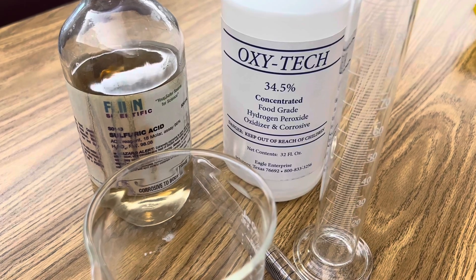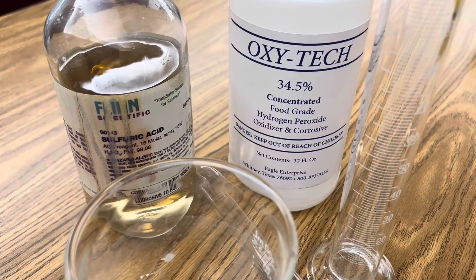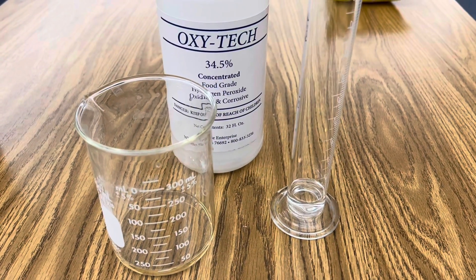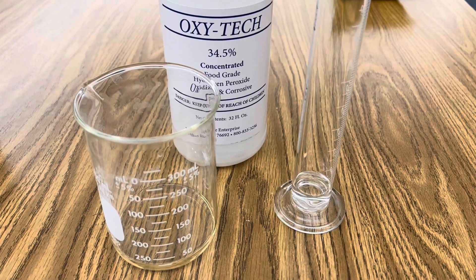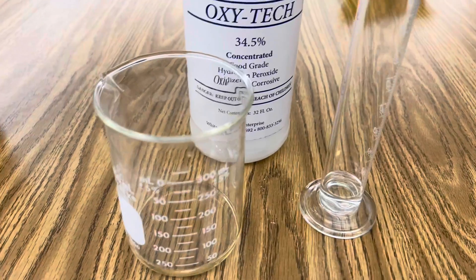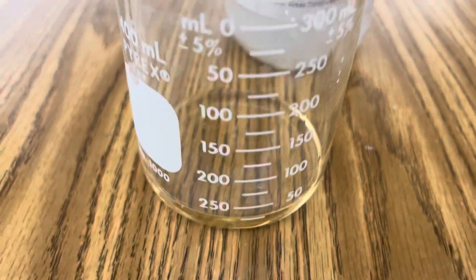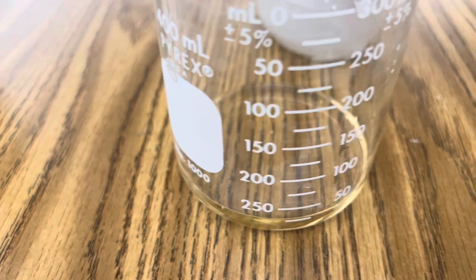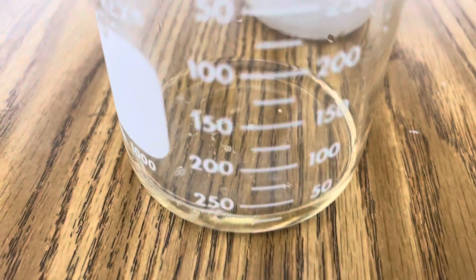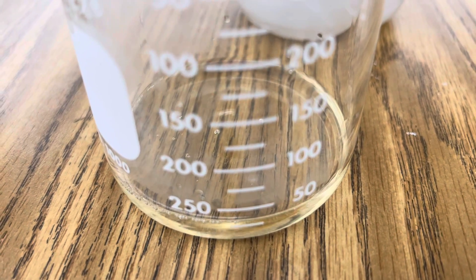All you need for this reaction is sulfuric acid and some concentrated hydrogen peroxide. Mix a 3 to 1 ratio — three parts sulfuric acid, one part hydrogen peroxide. Very slowly add your hydrogen peroxide to your sulfuric acid. Never pour sulfuric acid on hydrogen peroxide.